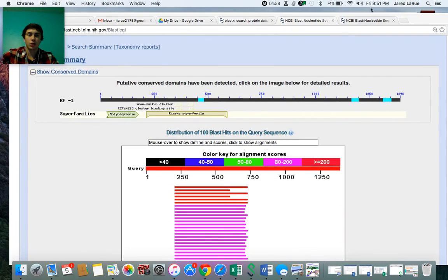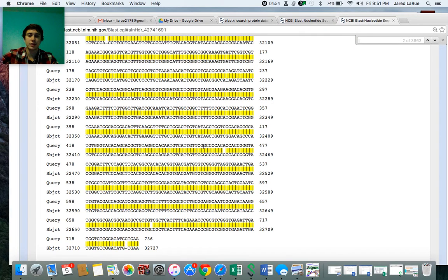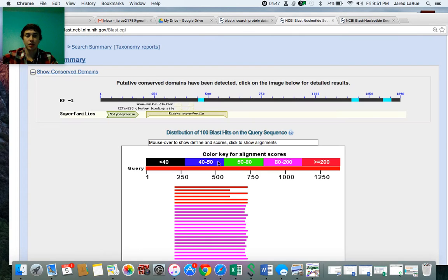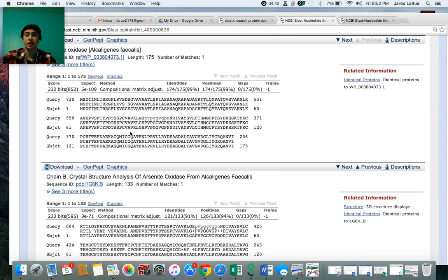Right, so as I mentioned in the last video, you can go to the BLAST and check your nucleotide sequence against the database's nucleotide sequence to see if there are any errors. Very similarly, you can do BLASTX, which takes your nucleotide sequence, turns it into an amino acid sequence, and compares it to their amino acid sequence. There is not a very good way to highlight the errors in this one. Hopefully there aren't any or many errors, and if there are, it's pretty easy to see.